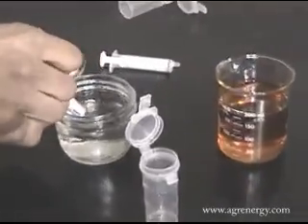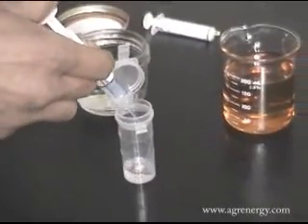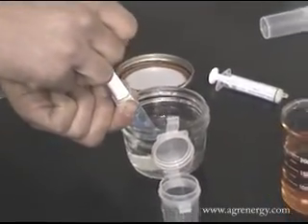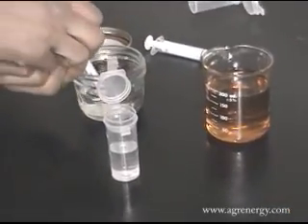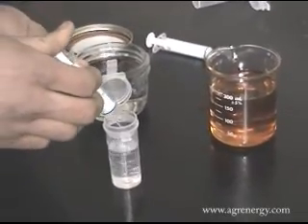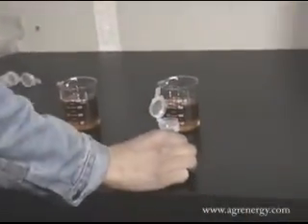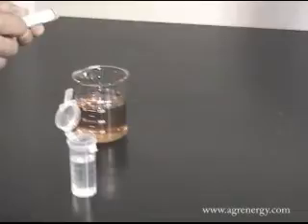This is a 10 milliliter syringe, so we're going to fill it up once, twice, and then 7 milliliters in it. So that's where the 27 comes from in the 27-3 test, is the 27 milliliters of methanol alcohol.